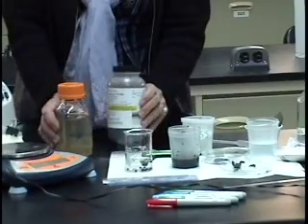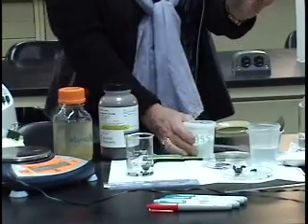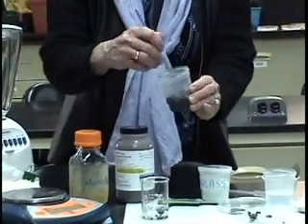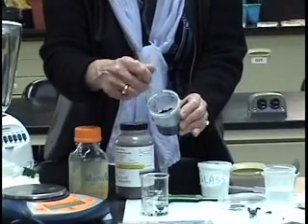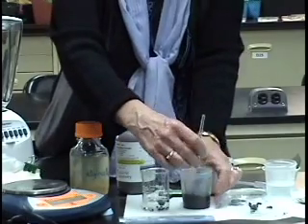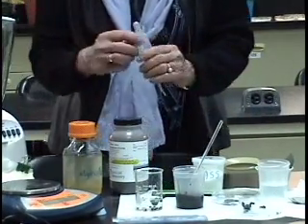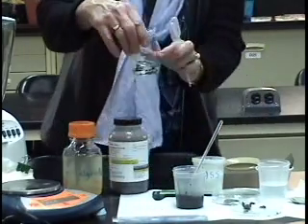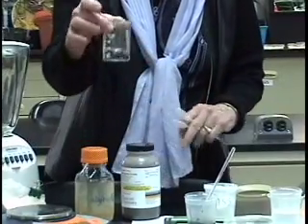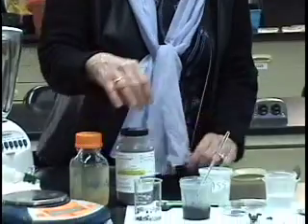Okay, so after the alginate and manganese dioxide and glass mixture is prepared, you would distribute small amounts of this to each lab group, and then give the students the challenge of trying to create different sized particles, because when the alginate manganese dioxide glass mixture hits calcium chloride, it changes to a semi-solid form.